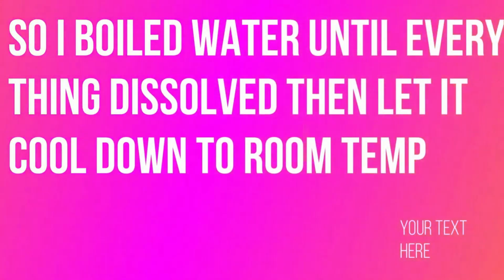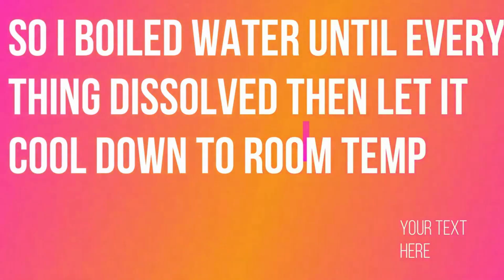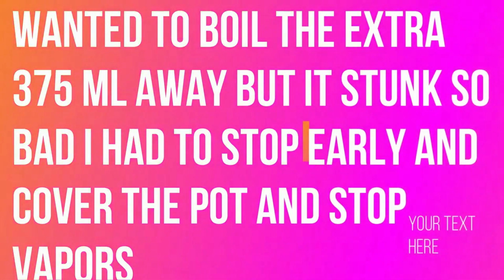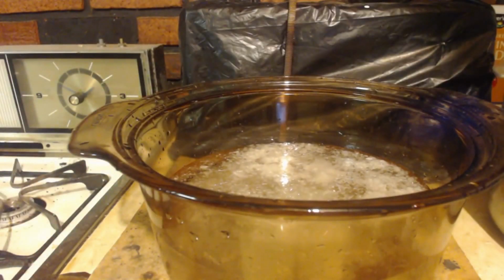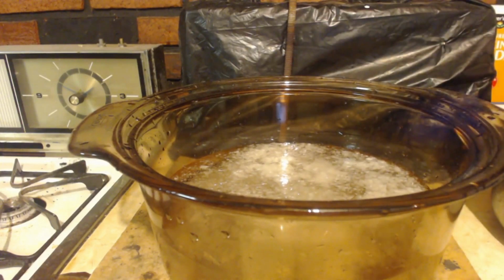Alright, so I brought this to a boil. Made sure everything was soluble. You can see I got a lot of crap in there. So I'm going to pour it into this glass container. Okay, I'm going to put that in the refrigerator and the freezer, let it cool down so some more stuff can precipitate out. Check it out. Got it cooled down. It's got a lot of stuff in it. We're going to filter it all out.